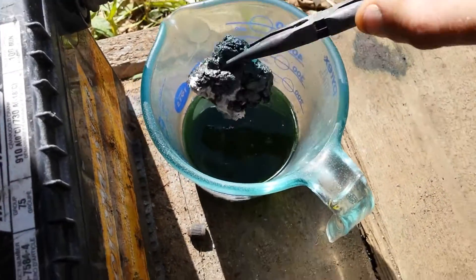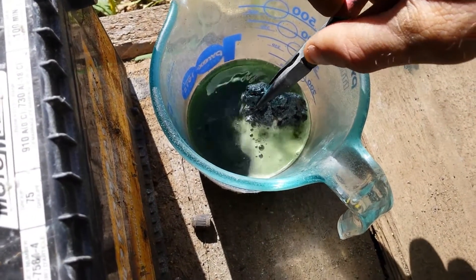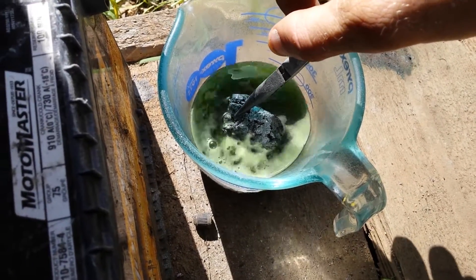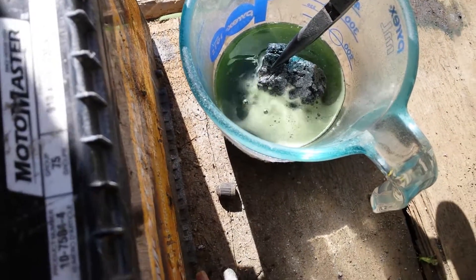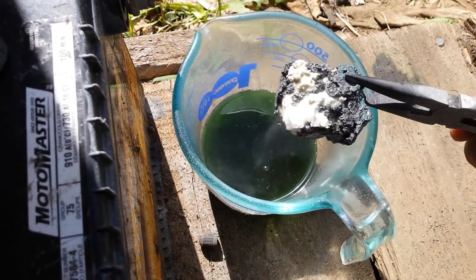The water's pretty green now too — it was blue for a while and now it's pretty green. And I'm sure it's also dissolving copper and whatever other kind of crap's in this rock in the middle that I can't see. But it's crazy — you can just watch it blasting out all that rock from in there in those bubbles. And you pull it back out and you literally watch it change.